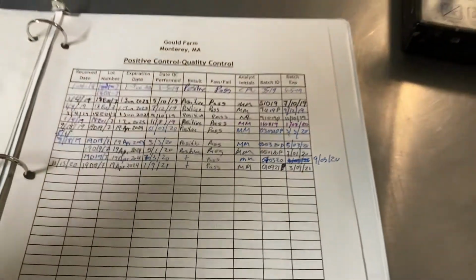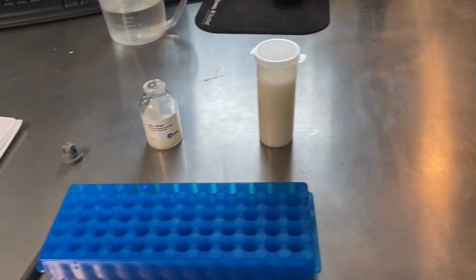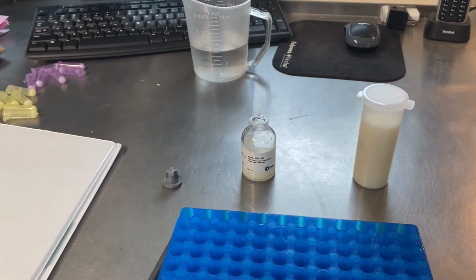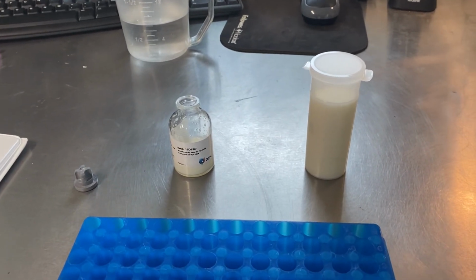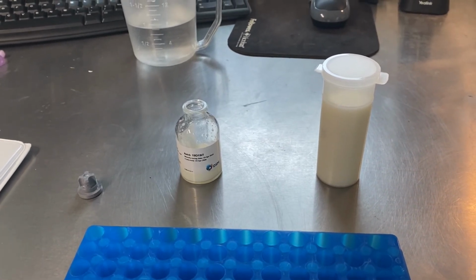So that is it. That's all we have to do for our test and our quality control log, and that's it. And then it's just cleaning up. So everything gets put away. The samples are only good for 1 day. So if you know that you're going to need a sample in the next 24 hours, you can use these on the day that you make it or the day after, but they're technically not any good anymore after that.